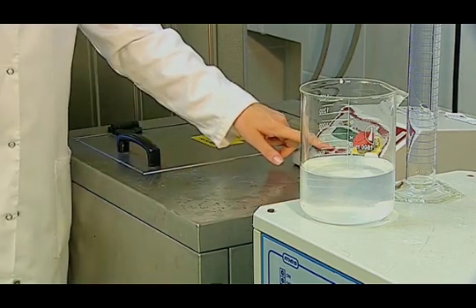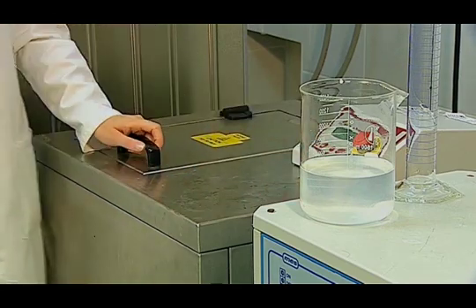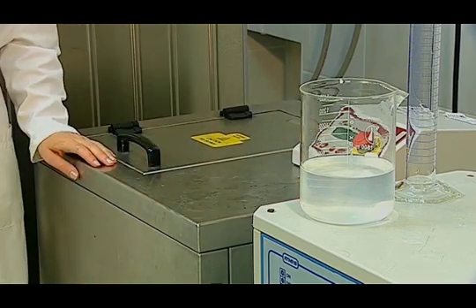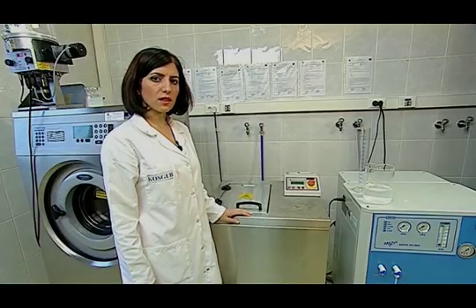By pressing the start button, the test is started. This time, the sample is subjected to the test for 30 minutes in the device.